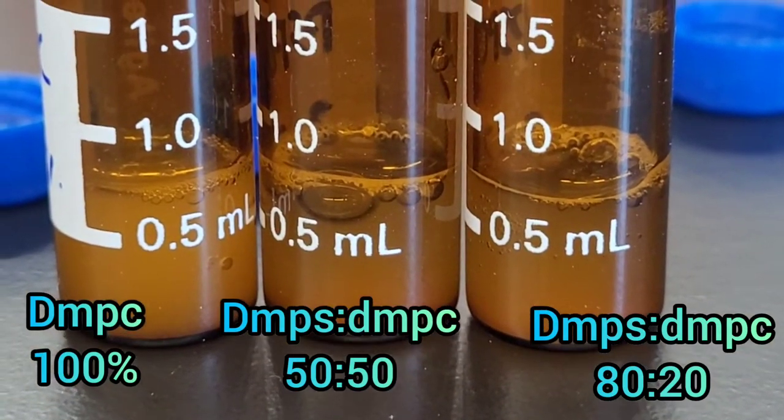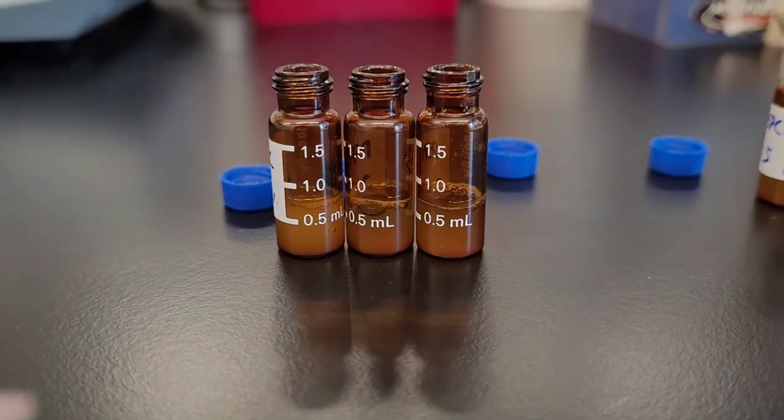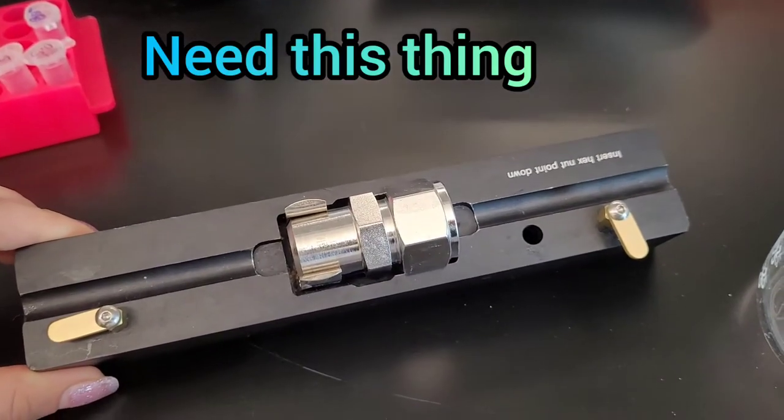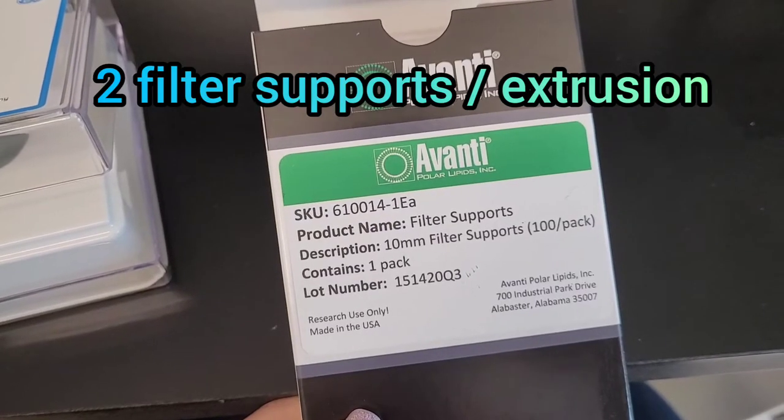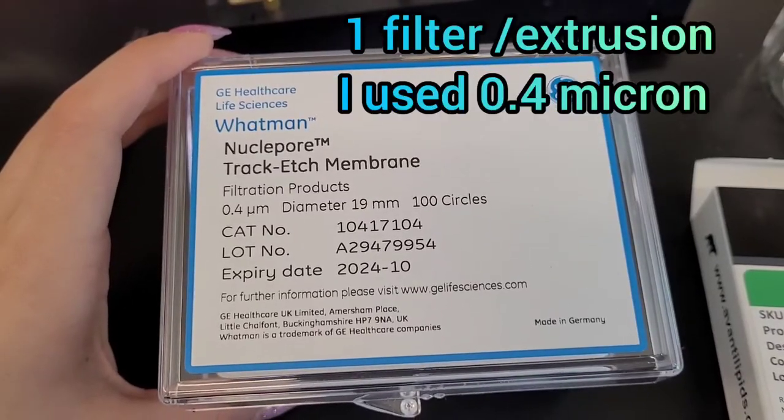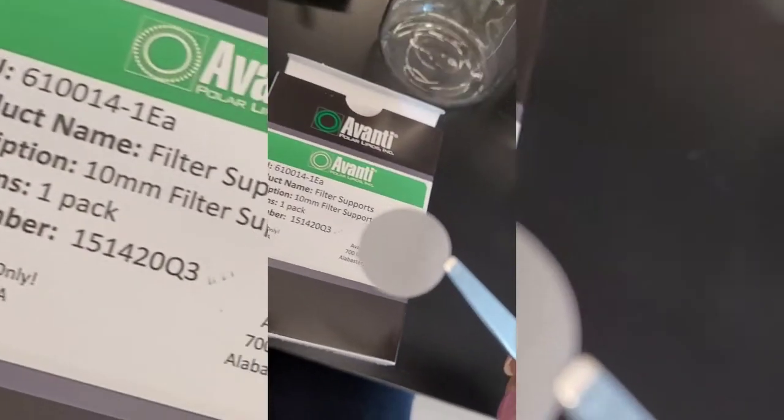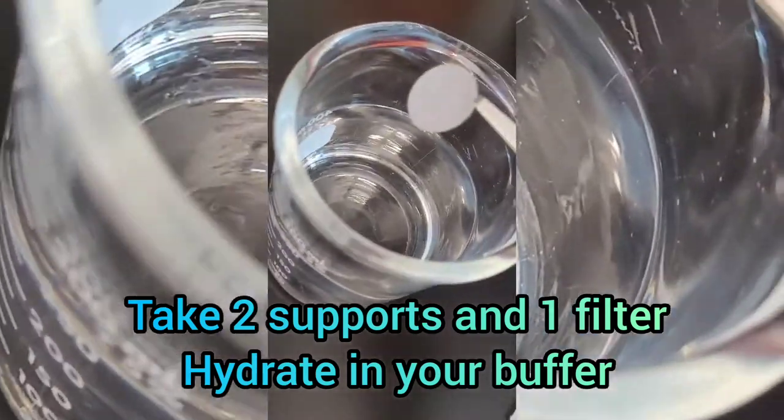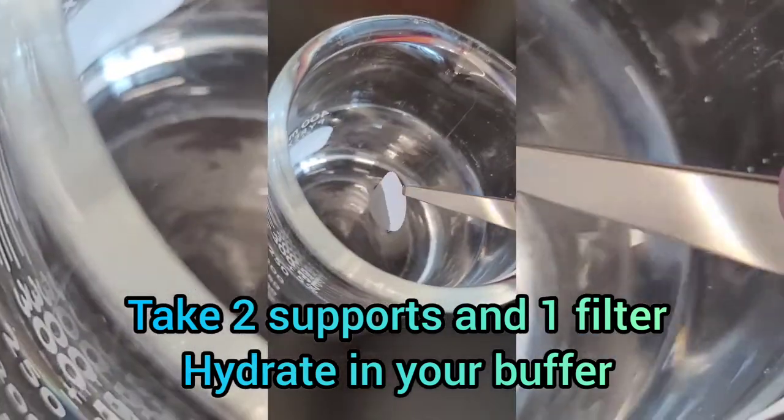Make sure it's well mixed. Then you need this device with support filters and actual filters. The ones I'm using are 0.4 micron, and you need to hydrate the filters.